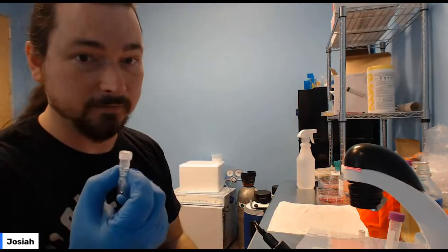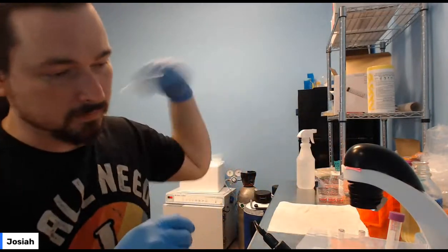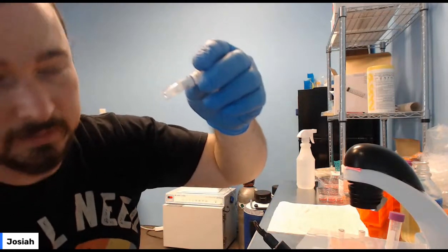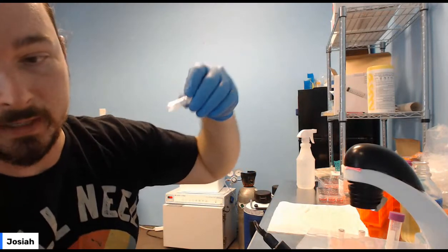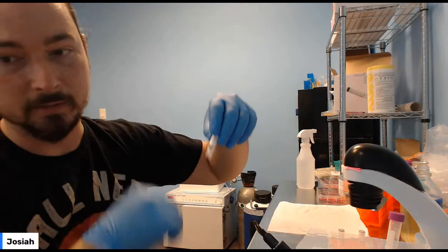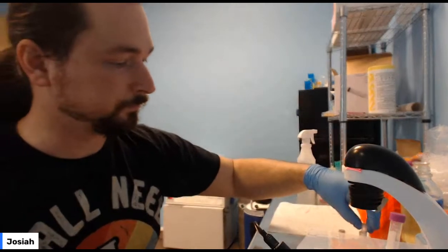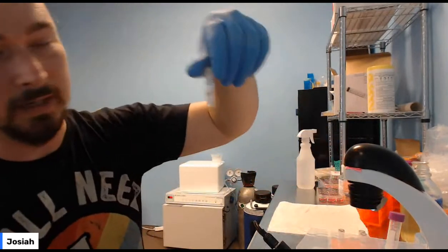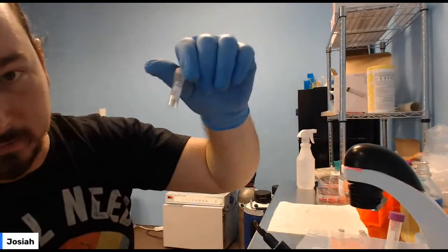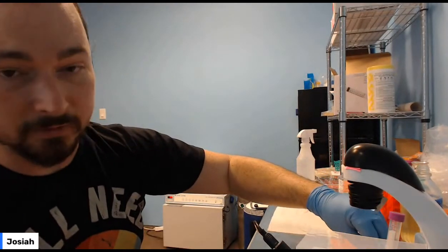This is 55 microliters of plasmid, and then you'll also have calfectin. It's going to be a really small quantity, so it's very difficult to see, just a drip at the bottom. In shipping, it may be stuck to the sidewall or the top, so you may have to shake it down a few times to get it to the bottom. Then we'll have our G418, which we'll still be using, but not immediately, and you're going to have an XGAL solution. The XGAL solution and the G418 are used a couple of days after the genetic modification.